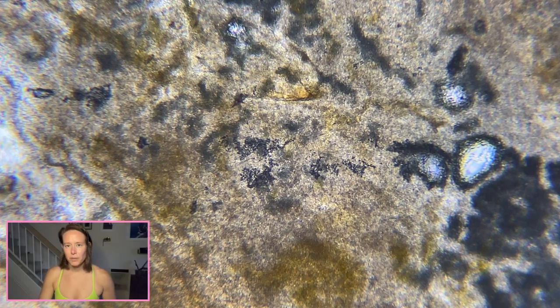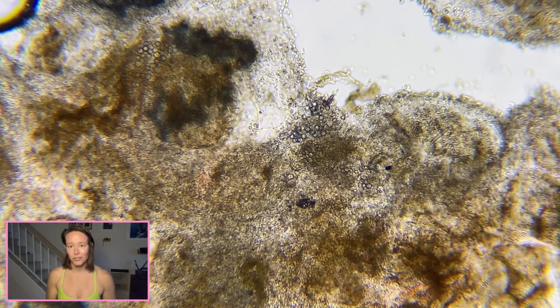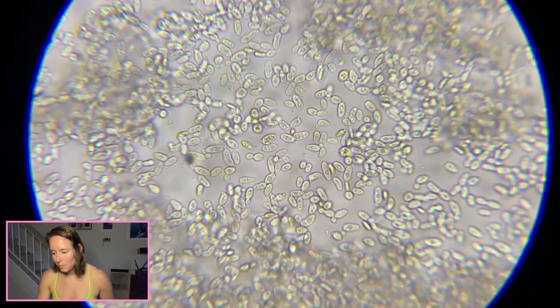This one had a lot of dark patches, kind of similar to what I saw in the experiment that was pitched using Lalvin Bourgovin RC212, but it also had random tints of orange, which was similar to the Lalvin QA23. When we zoom in, we can see that there are tons and tons and tons of yeast, lots of clusters of yeast. And if we move to a spot that, again, is not quite as crowded, we can make out those yeast shapes.